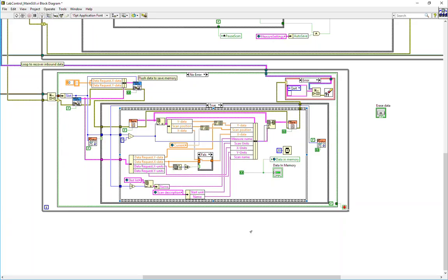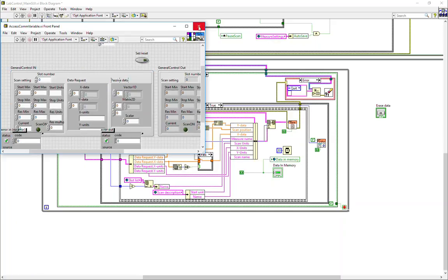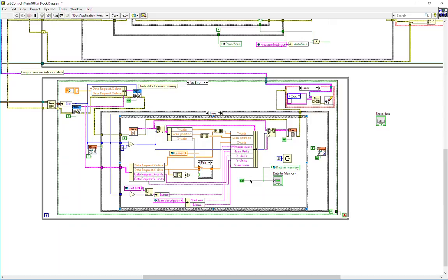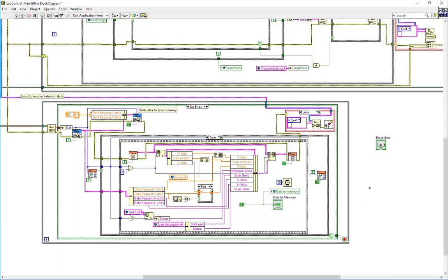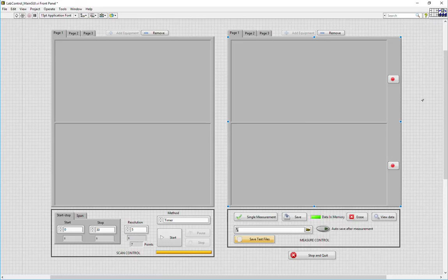For the communication, when data is transferred from an equipment to the main VI, the equipment sends an order to the main VI that data is currently available. In this case, a task is created with the information of which slot the data is available from. Then the COM variable of that specific equipment will be read and the data will be processed. Once all the data is recovered from the expected equipment VI, then a new position of scanning can be set, or the single measurement is done. So this completes the overview of the architecture of the lab control main GUI interface.